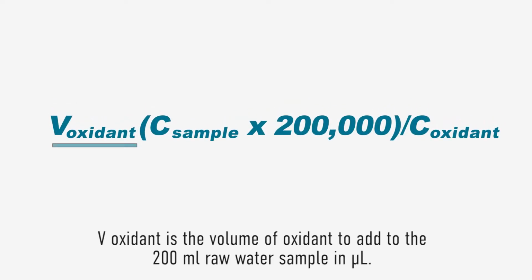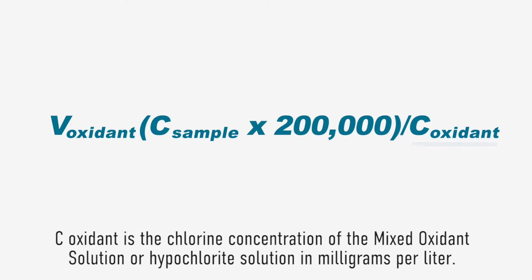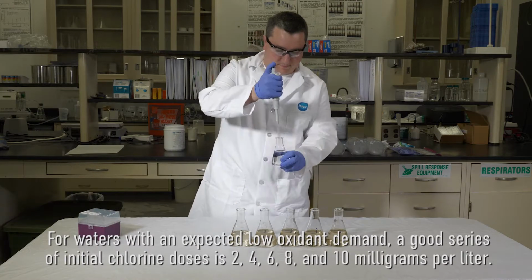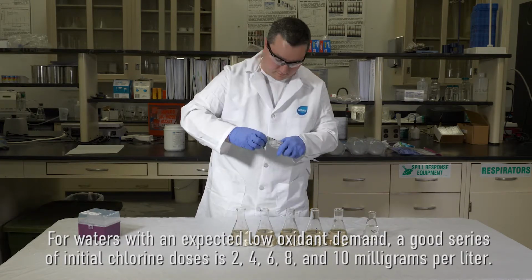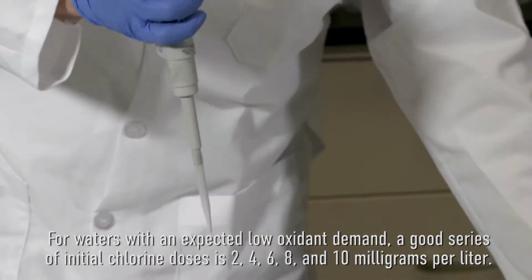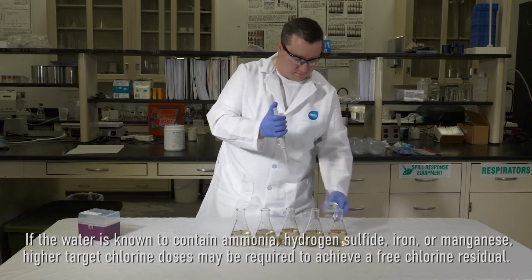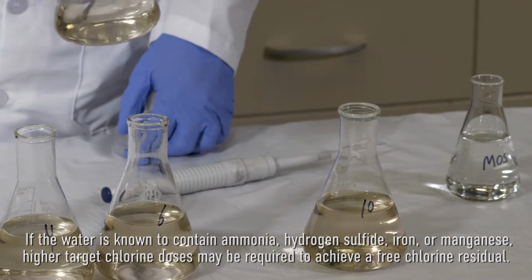In this equation, V oxidant is the volume of oxidant to add to the 200 milliliter raw water sample. C sample is the target chlorine dose of the sample in milligrams per liter. C oxidant is the chlorine concentration of the mixed oxidant solution or hypochlorite solution in milligrams per liter. For waters with an expected low oxidant demand, a good series of initial chlorine doses is 2, 4, 6, 8, and 10 milligrams per liter. If the water is known to contain ammonia, hydrogen sulfide, iron, or manganese, higher target chlorine doses may be required to achieve a free chlorine residual.